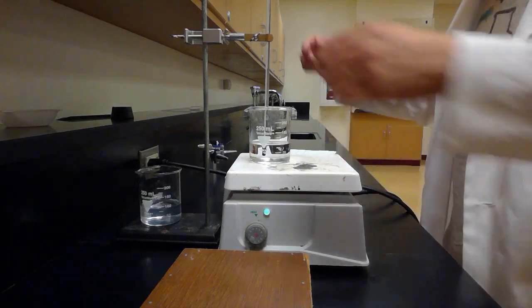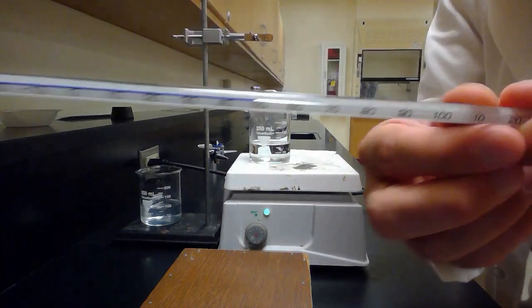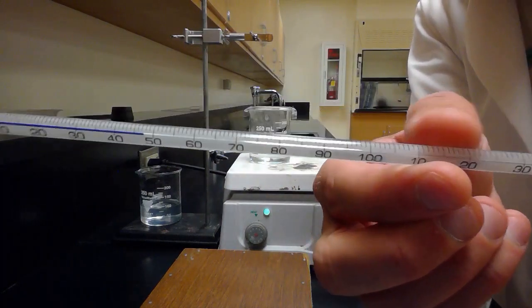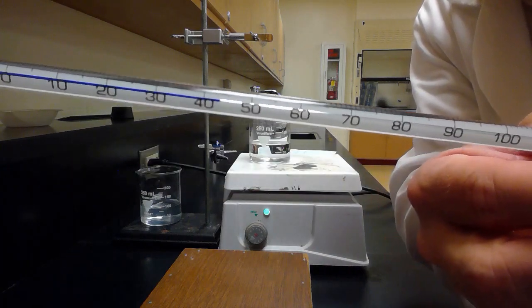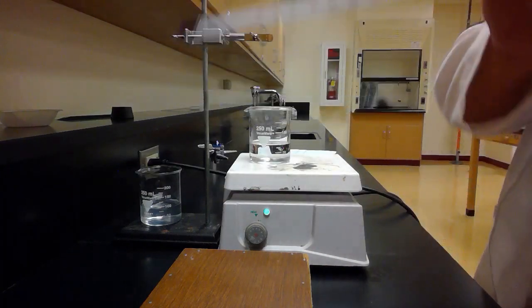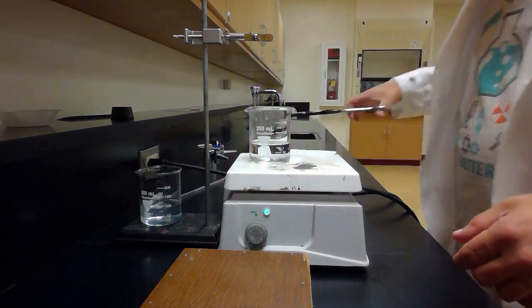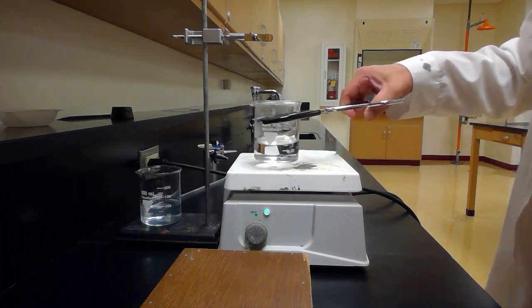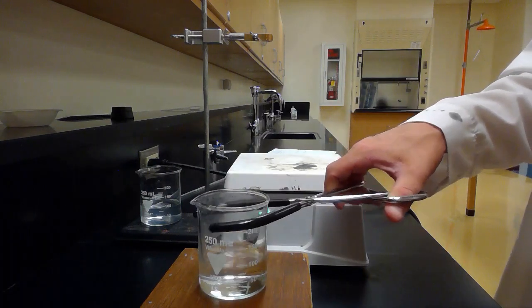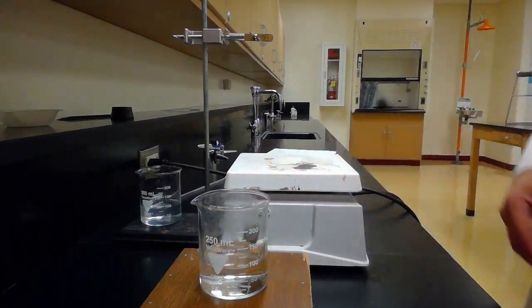There, we're about 50 Celsius. I'm gonna take it off, and hopefully I can get this up here. You can see temperature's probably falling pretty fast on the thermometer. Oh, it's going down, it's going down. It's hard to show you the thermometer because as soon as you take it out, the line starts dropping because it cools off really quick. But the water in there is going to stay 50 degrees Celsius for a while. It won't cool off so fast.